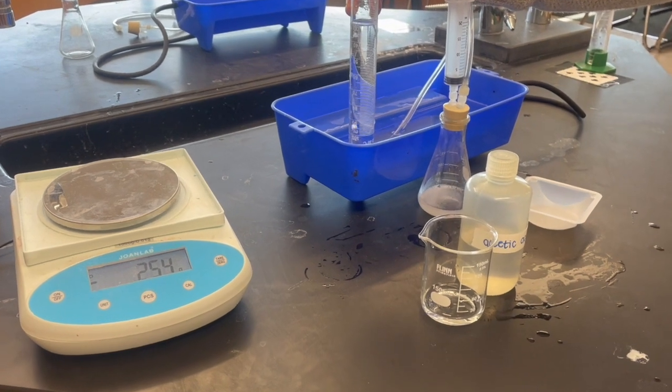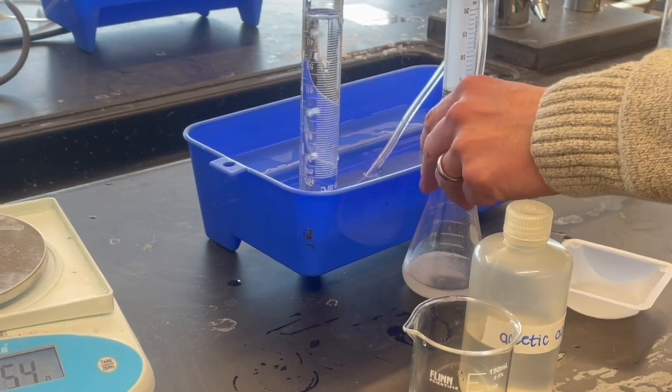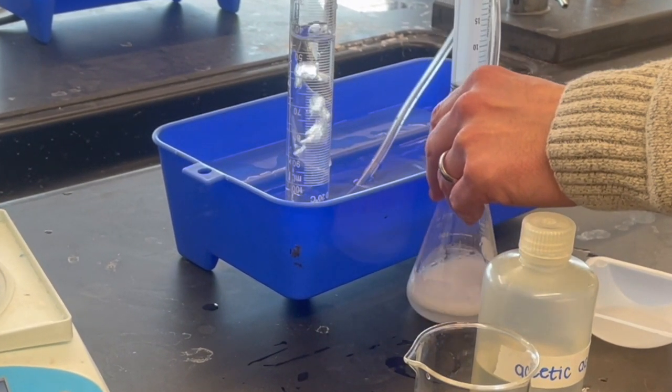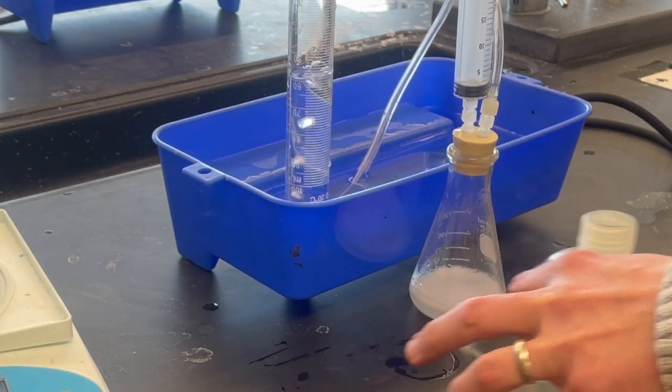The reaction begins to happen as you can see. The gas bubbles begin to float up inside the graduated cylinder, which is good because I'm trying to figure out exactly how many milliliters of carbon dioxide gas I will collect.